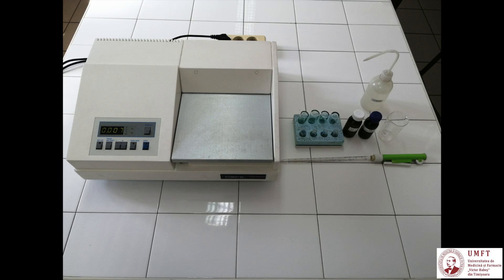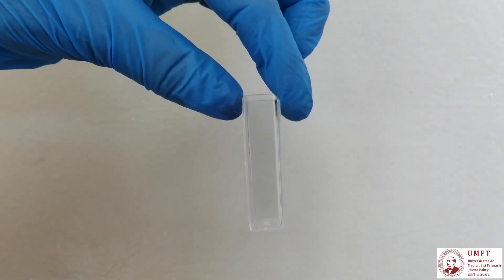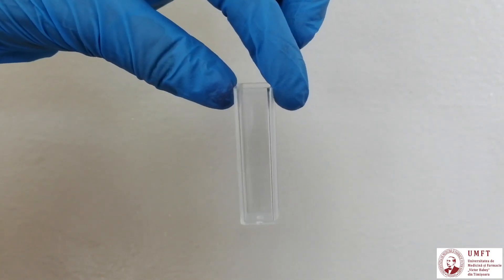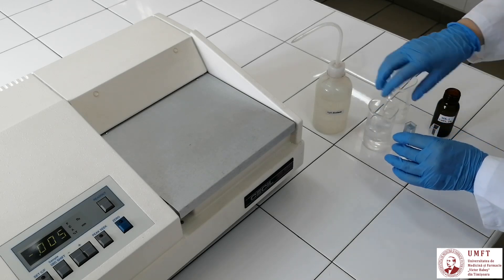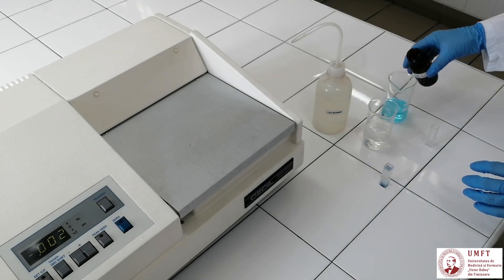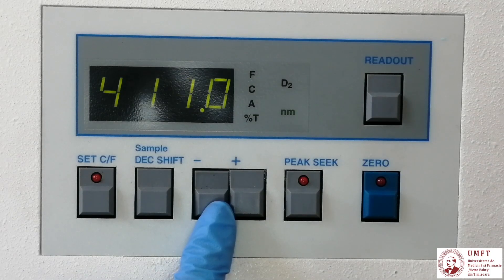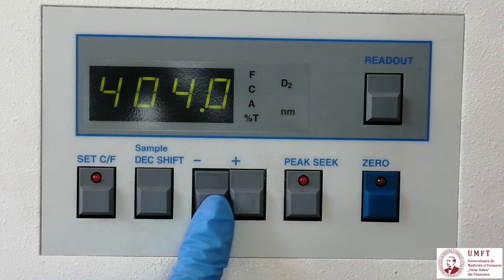Before starting any measurements, wash the cuvettes with distilled water and wipe the excess water off the outer surfaces using a paper tissue. Handle the cuvette in such a way that you don't touch the surfaces traveled by light. The cuvette has two parallel transparent surfaces and two with striations. Always grab the cuvettes by the superior side of the striated faces. Fill a cuvette with pure solvent — distilled water — up to about 1 cm from its top edge. Fill another cuvette with the 2% studied solution. Using the plus and minus buttons, set the wavelength values. For this experiment, the first determination will be performed at a wavelength of 400 nm.